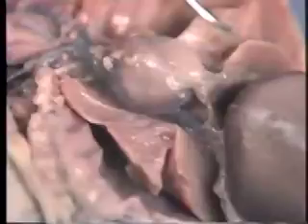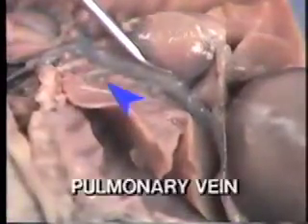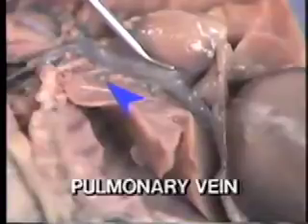Observe that each lung is divided into several distinct sections, or lobes. Observe also that the lungs surround the heart. By lifting the heart, you can identify the junction where the pulmonary veins leave the lungs.